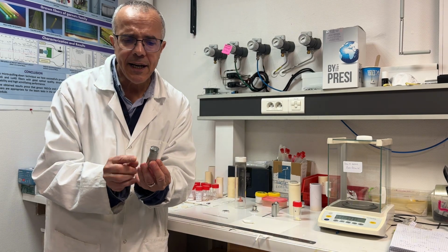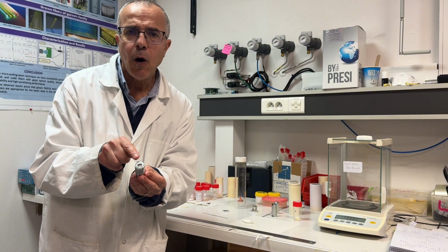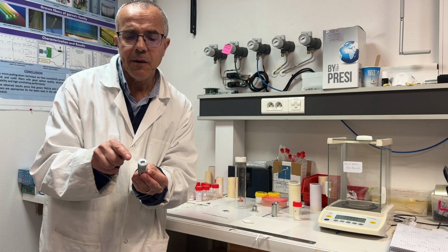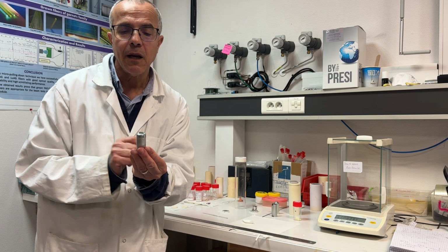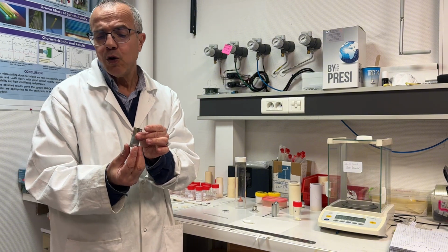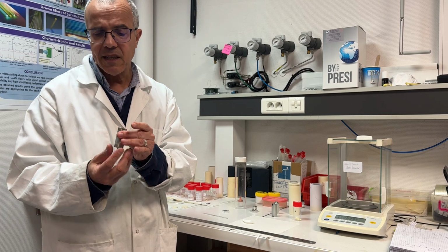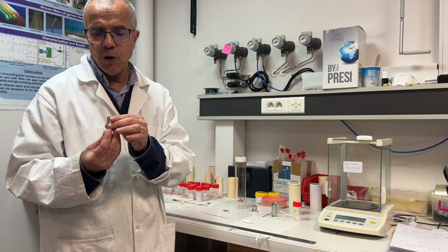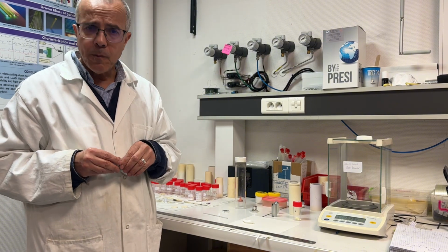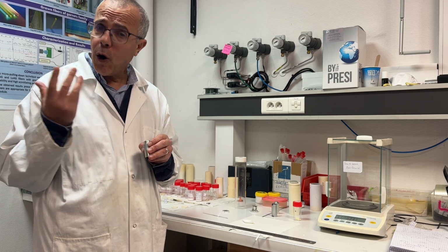You see here is an example of a crucible to generate plates of up to 10 centimeters long, 1 millimeter thick, and about 10 millimeters wide. So here also it is a special design which allows us to grow laser crystal, scintillating crystal, or ceramic crystal. It depends on the needed application. And now I will also show you another important point to grow fiber or even plates.